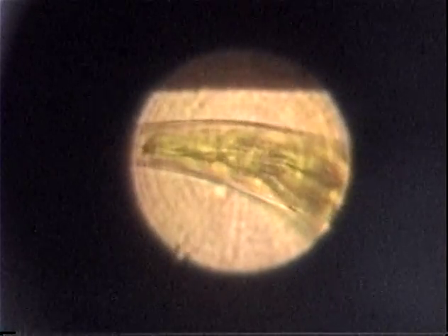Can we find it yet? I'm trying, guys. I apologize for this. It looks like I need some oil in this mechanism. Right up there. Are we there? You have it. All right, we just need to go off to one side. There's something really big moving inside of it right there. Yeah, see that?